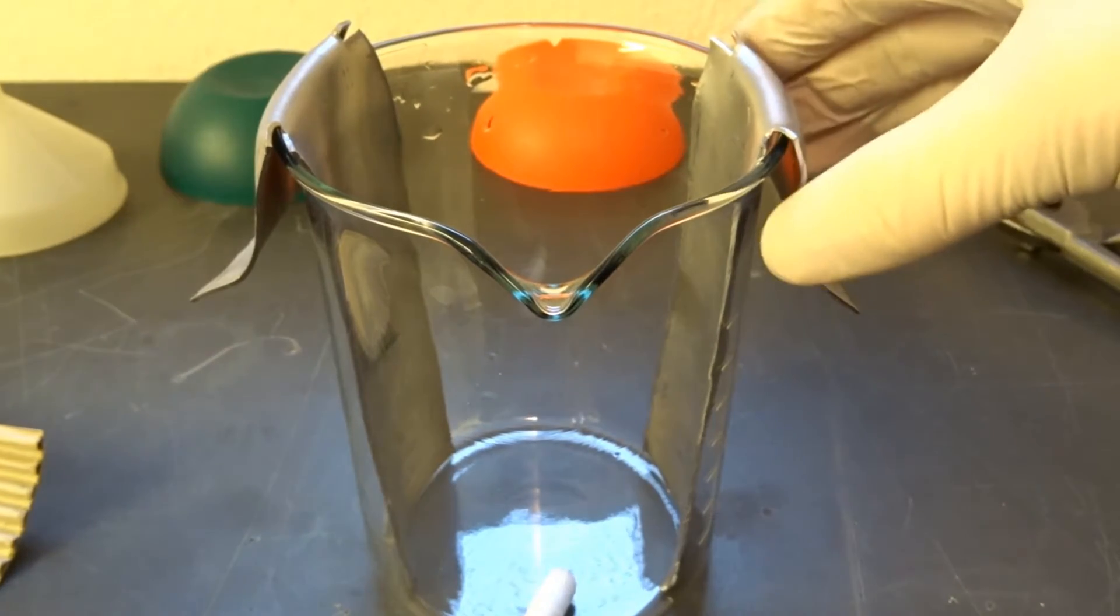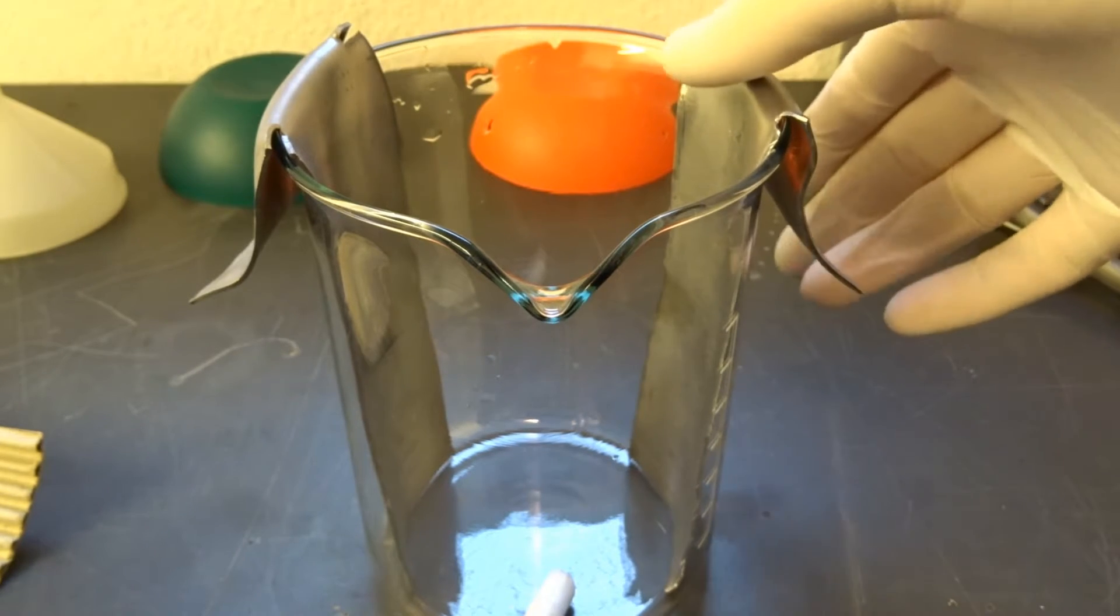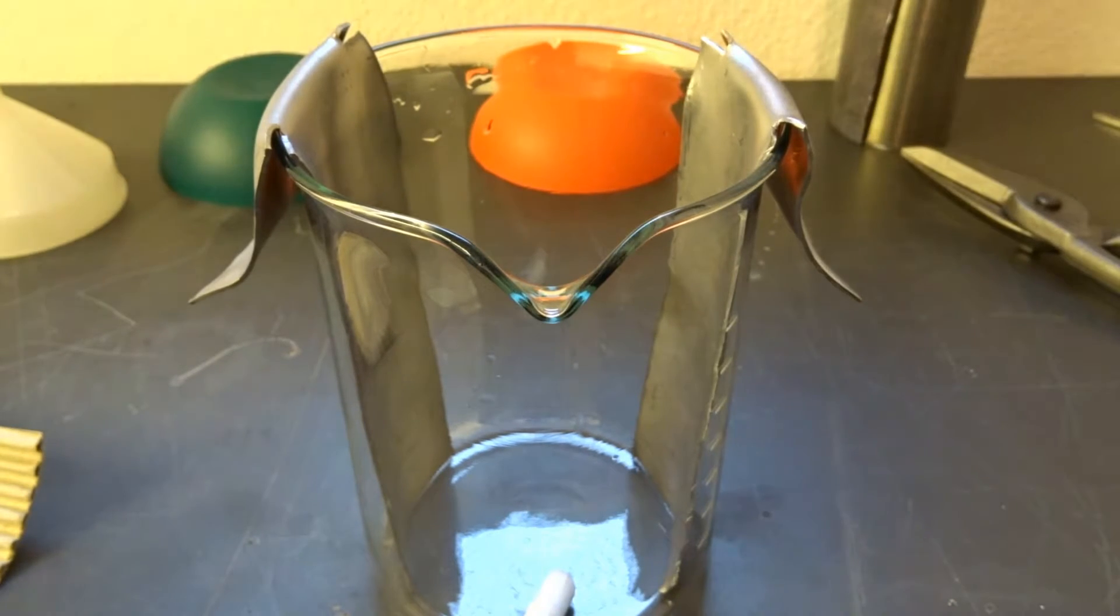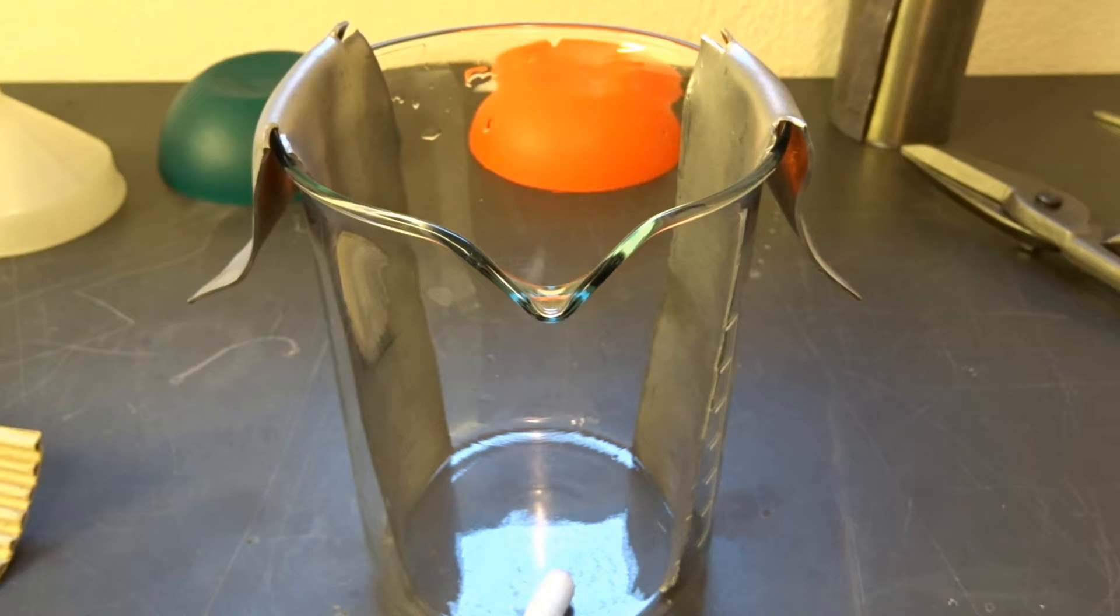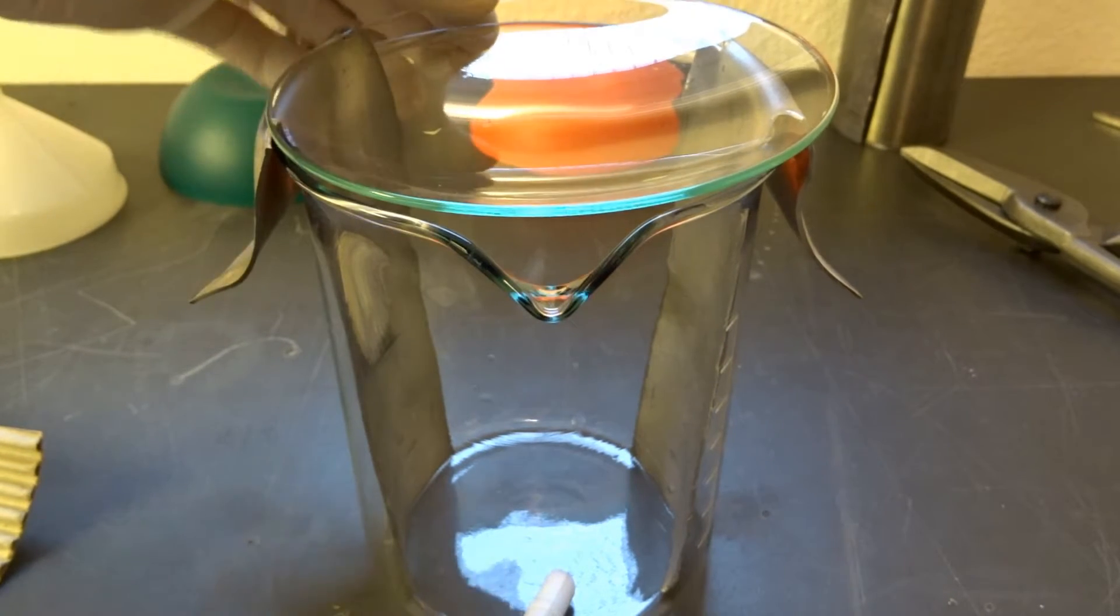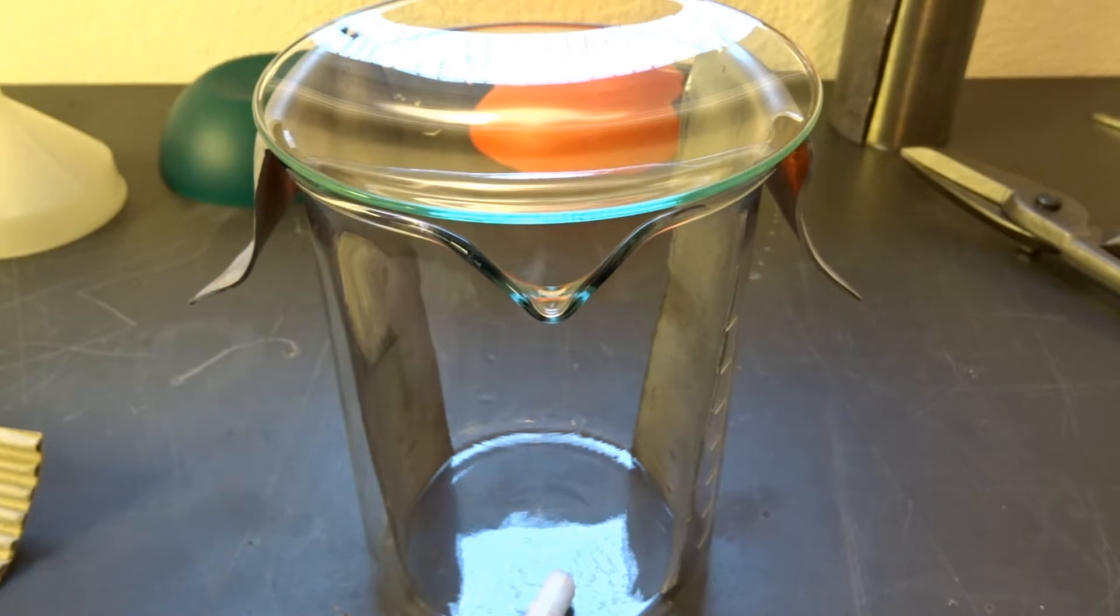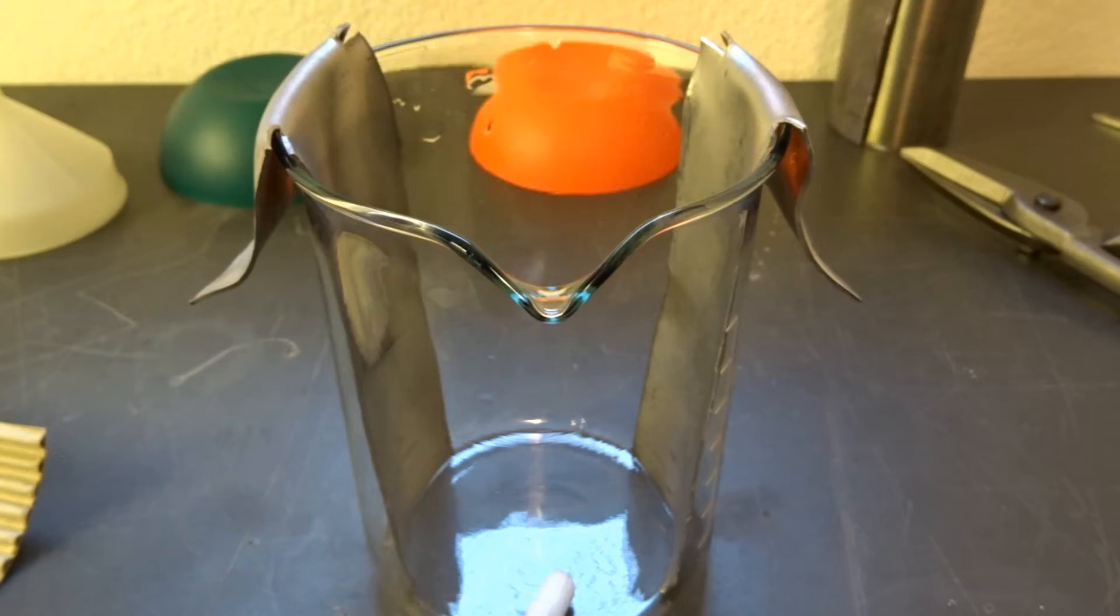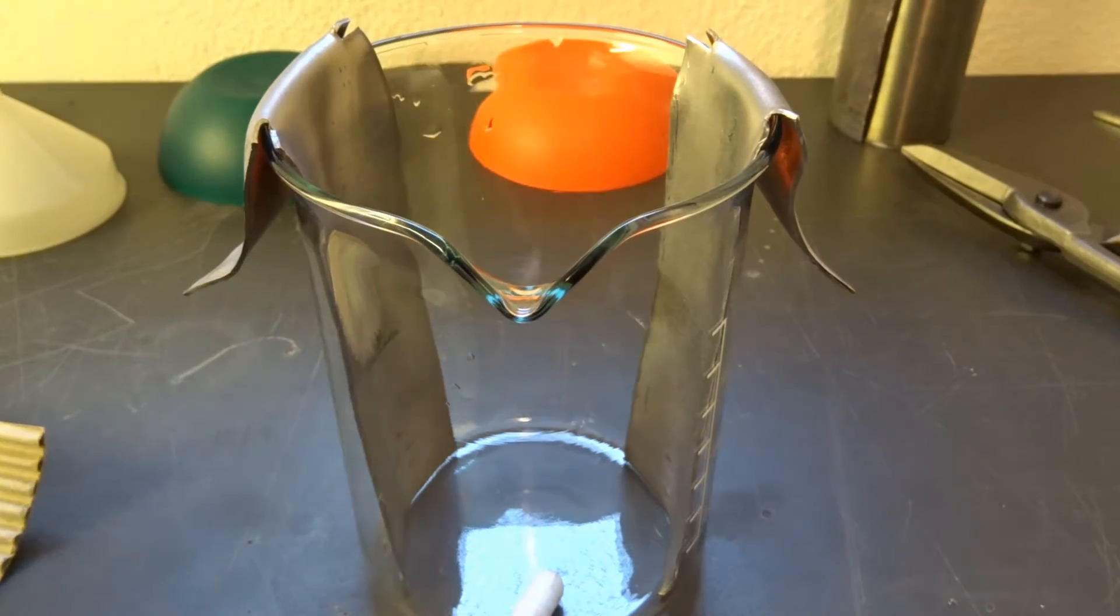As you can see, I've now prepared the lead electrodes. They're sitting in here pretty tightly. Everything can be covered with a watch glass which prevents the fumes from getting out. Pretty nice things, these watch glasses for a wide range of fumes.